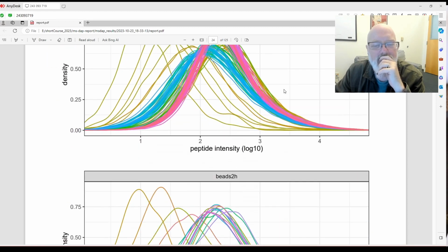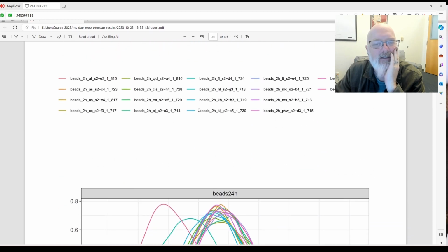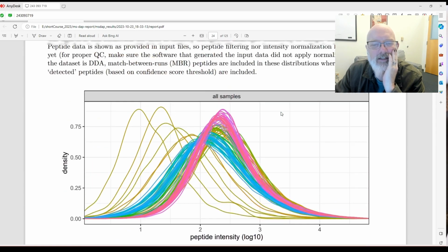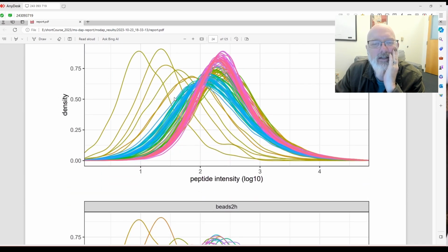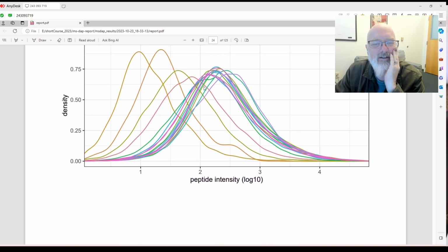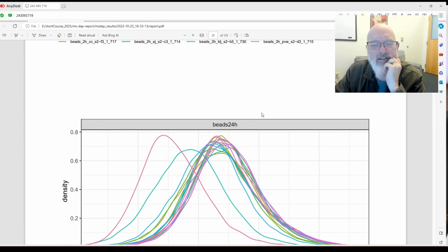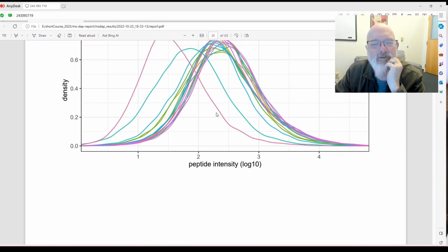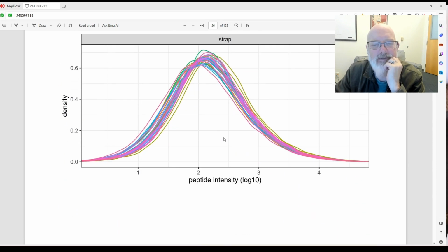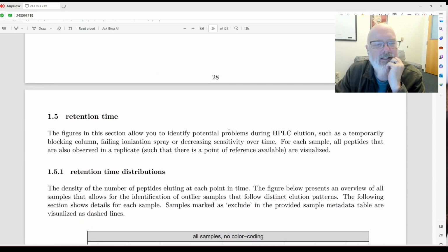Okay, all right. So this is peptide intensity per experiment. There's probably a legend down here. Okay, so beads. I think this is just for the contrast. Oh, this is all samples. And this is for the beads, 2 hours. And you could see these are kind of outliers. Let's see here. So you can see the legend here. Beads 24 hours. So this kind of tells you these two are probably the outliers. So S-traps are more consistent. Urea is pretty consistent, which is nice.